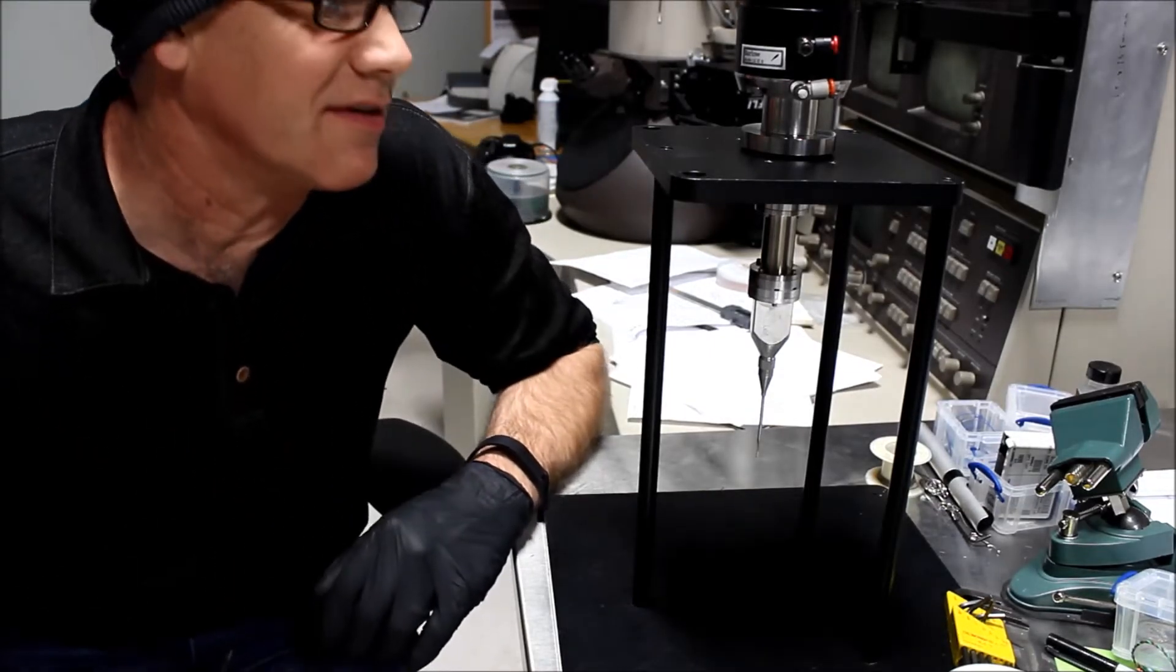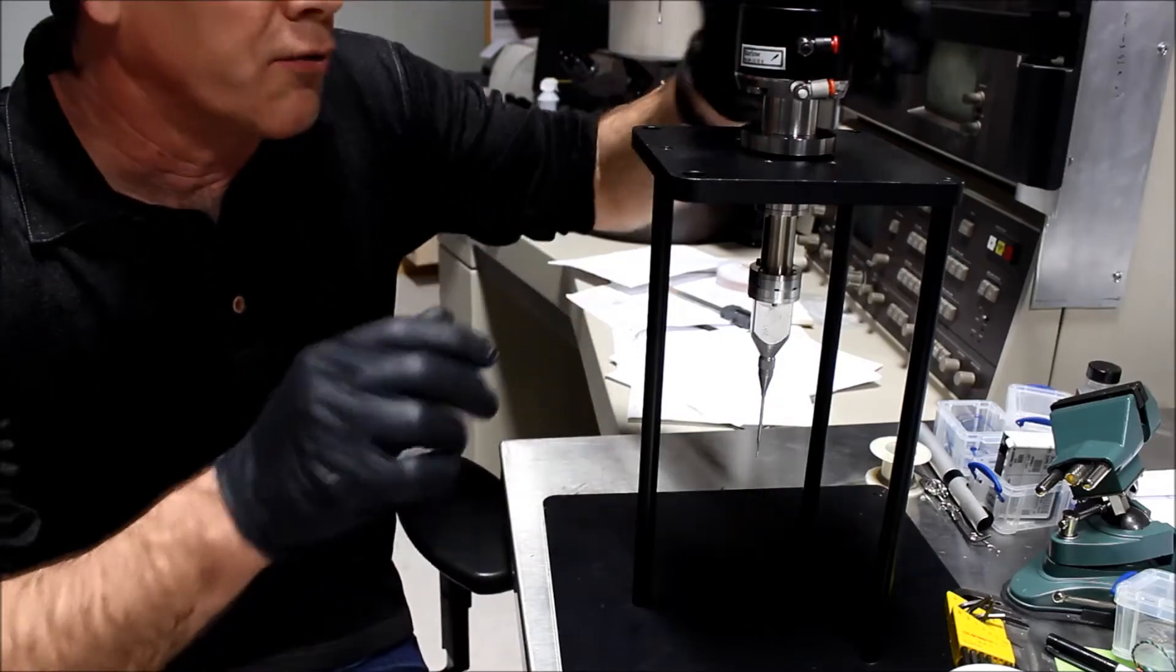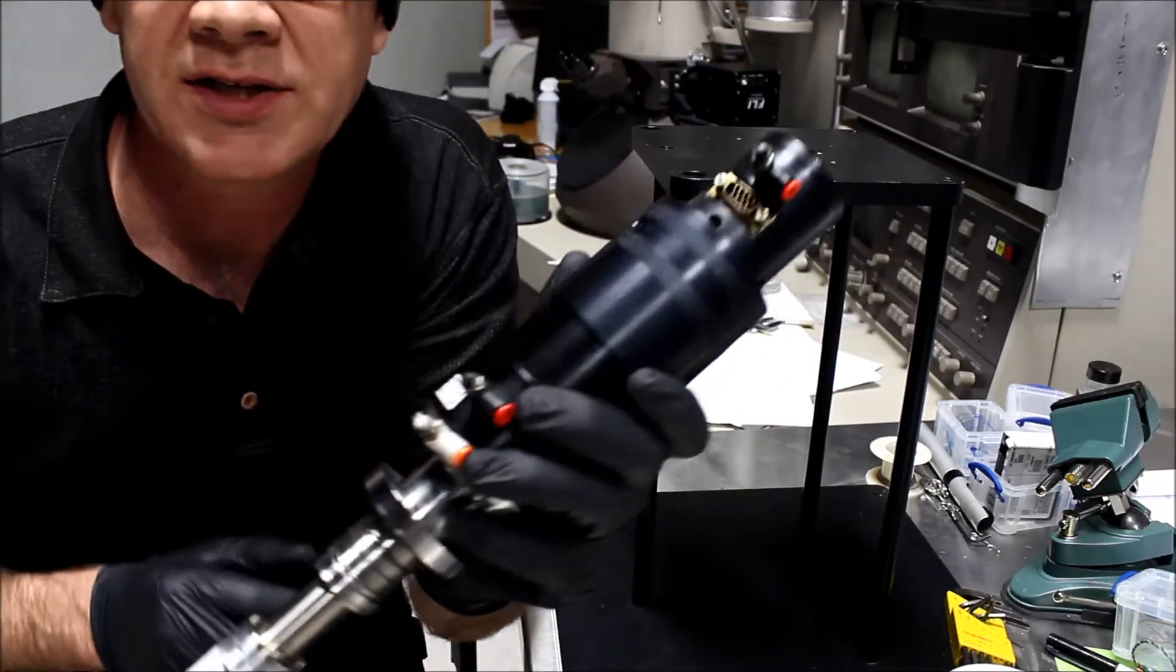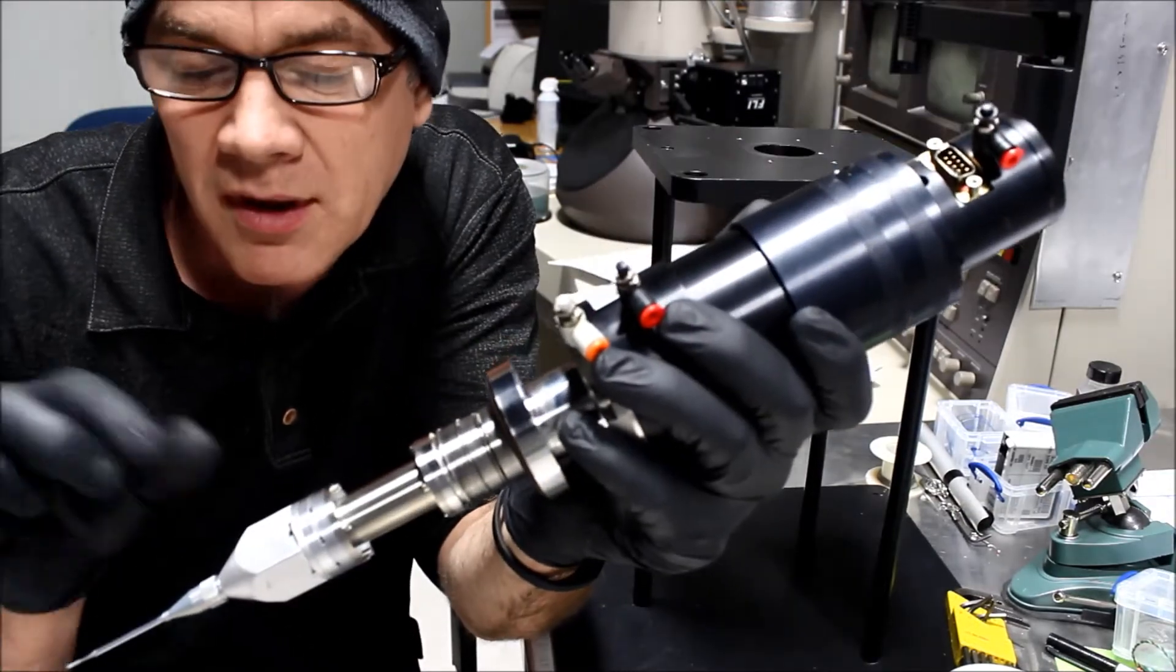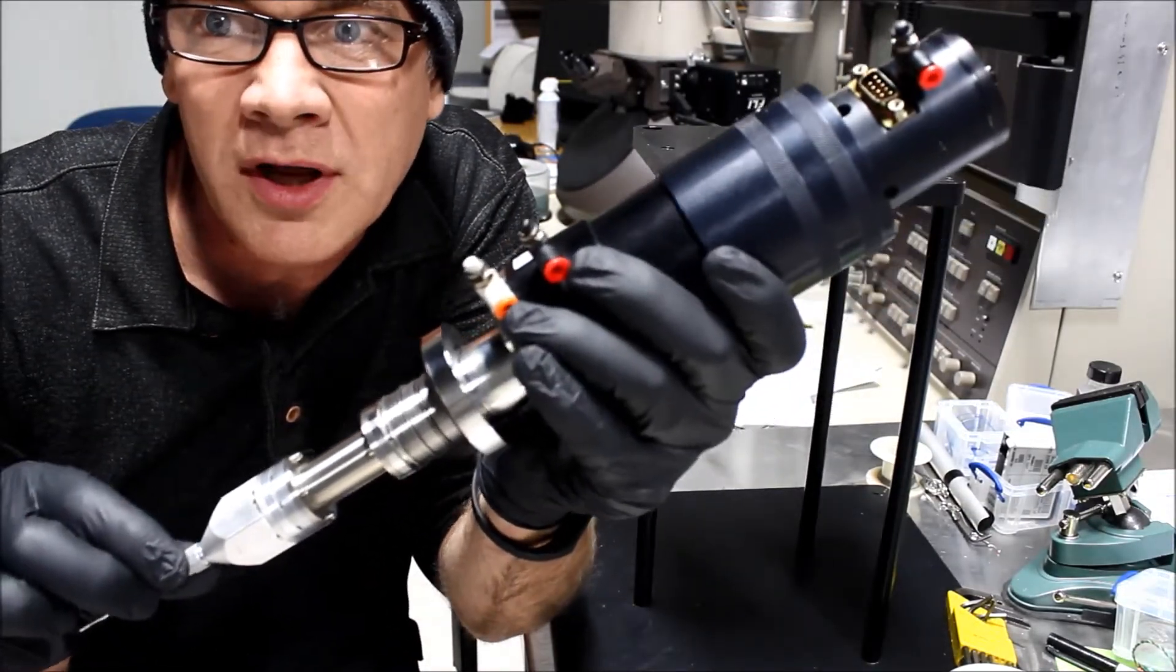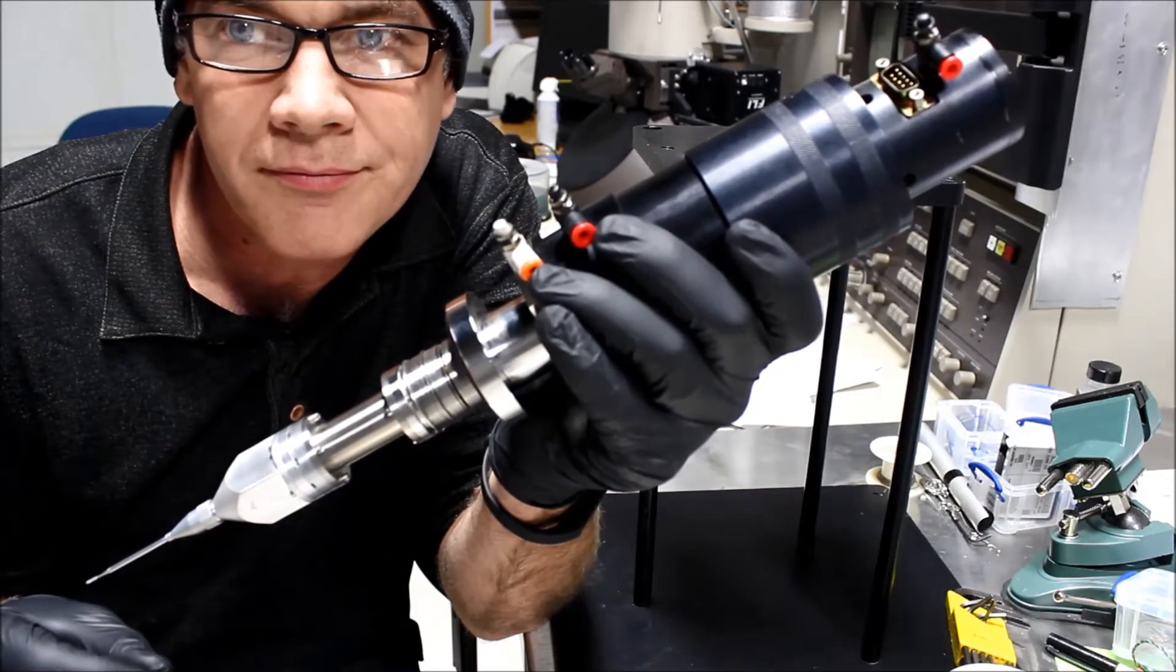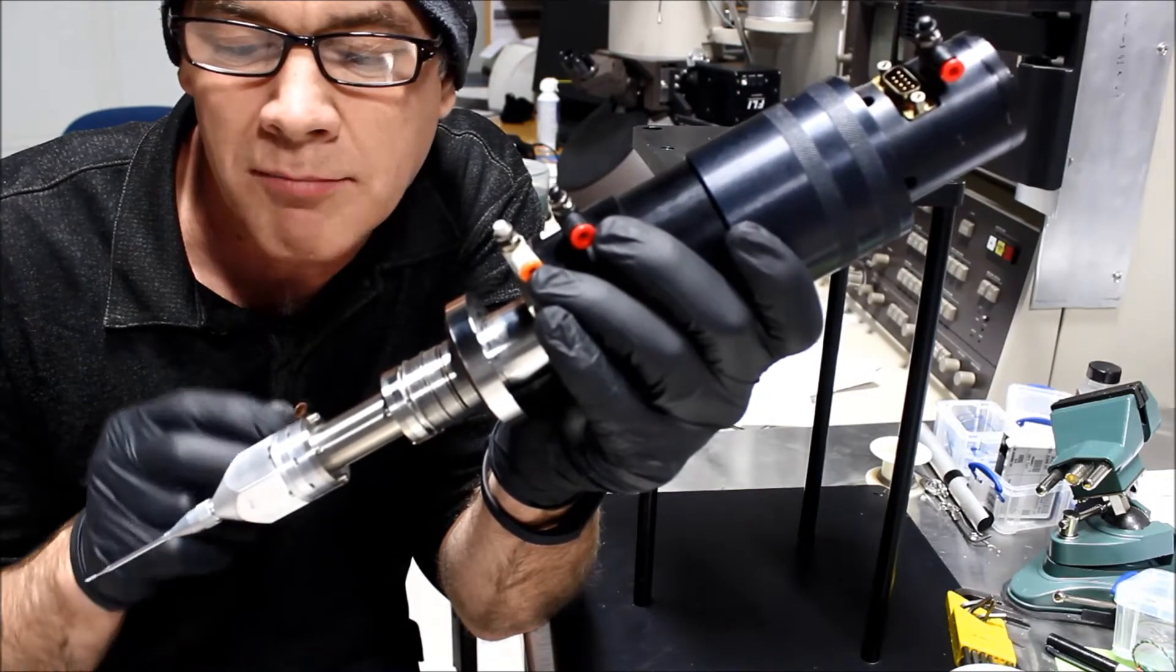Hello FIB users, this is Kevin, and what I have here is an FIB gas injector. What I'm going to do today is demonstrate how to disassemble and refill the FIB gas injector.